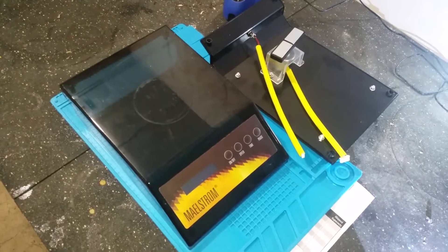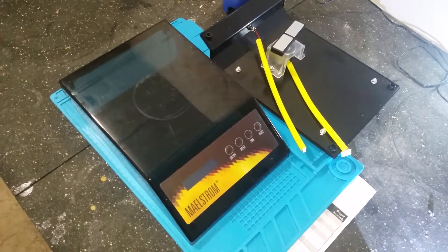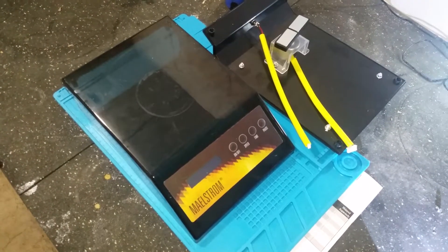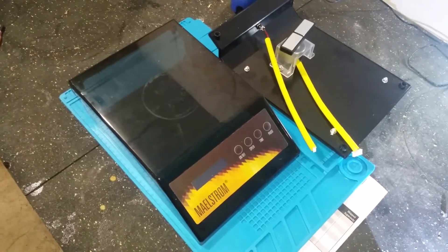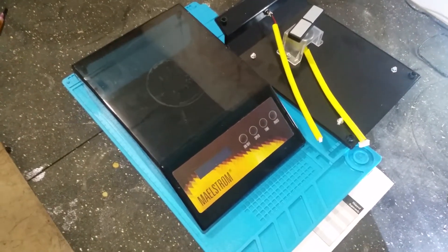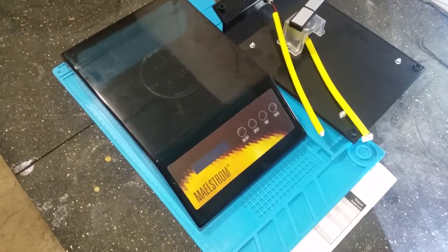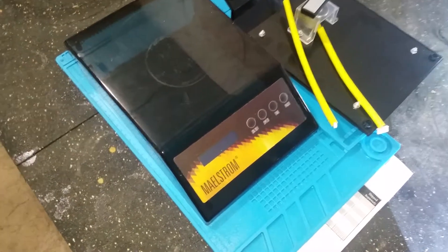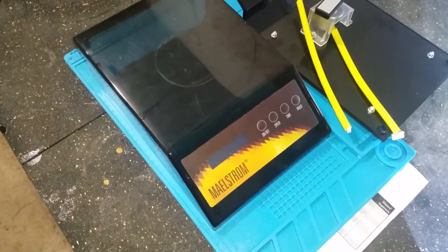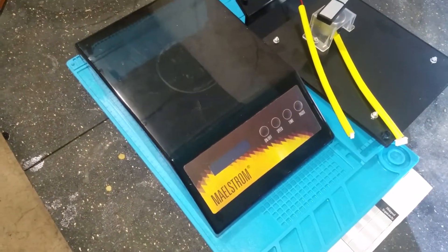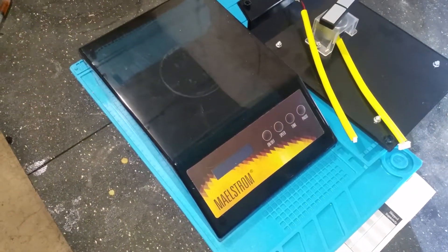The instructions don't have any troubleshooting guidelines. I'd start it and the speed button light would just flash.